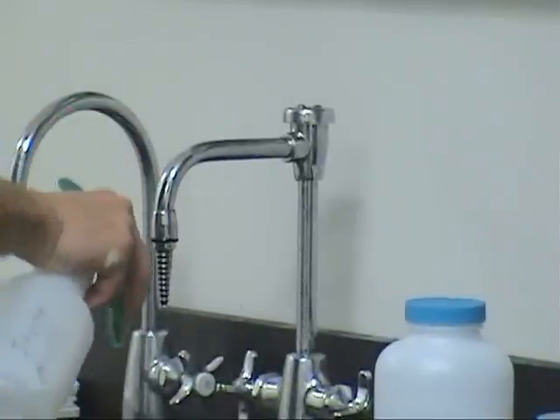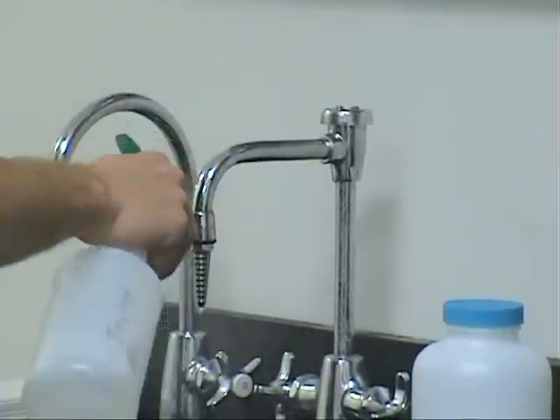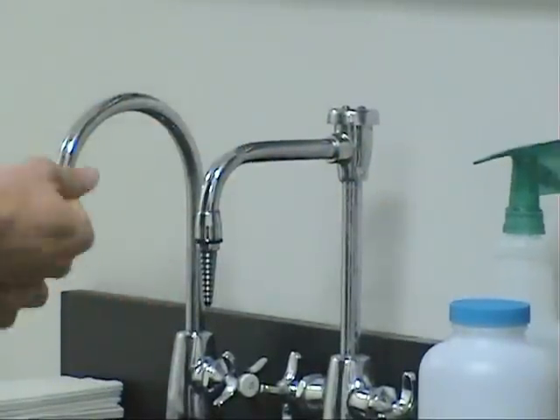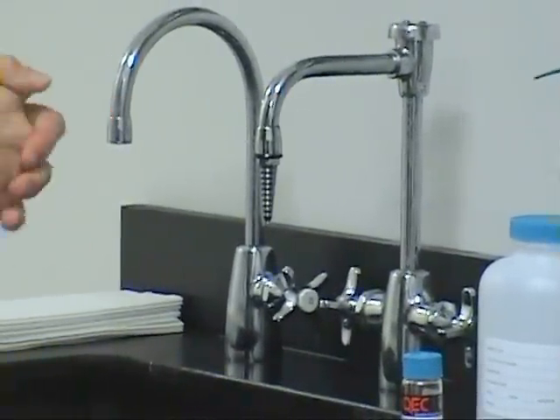Sanitize the nozzle of the tap by using a 10% bleach solution. Make sure that your hands are clean or you wear gloves while sampling for total coliform. Flush the water tap for 3 to 5 minutes and label sample bottles appropriately.